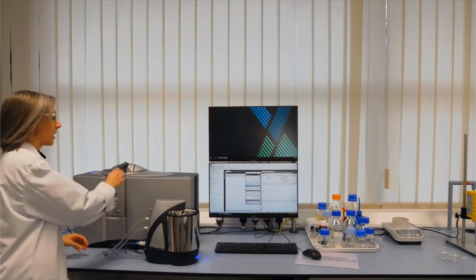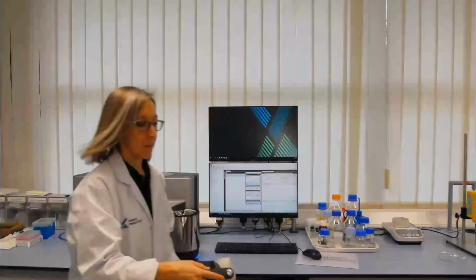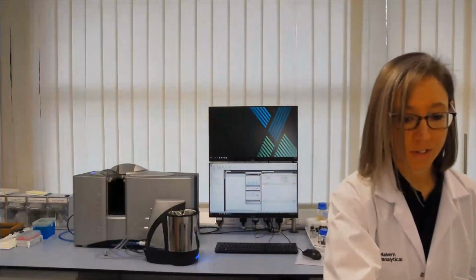So just disconnect the tube and pop the cell out, and I'll show you how to clean it over here.